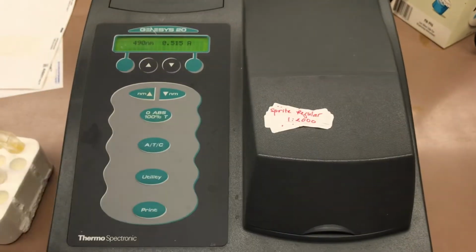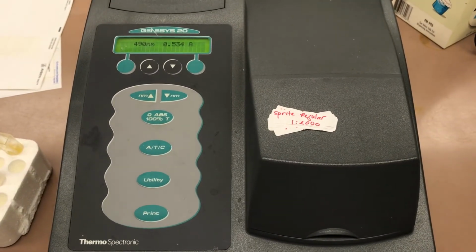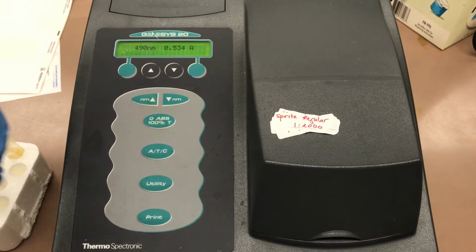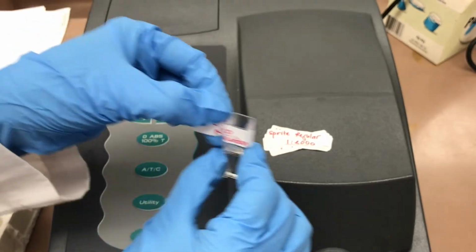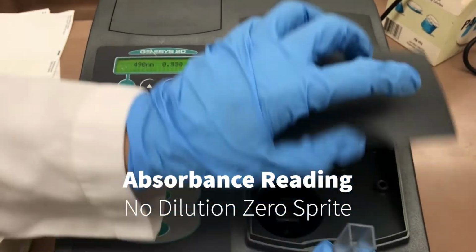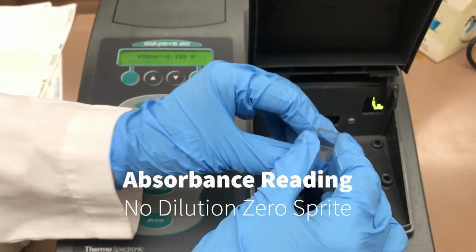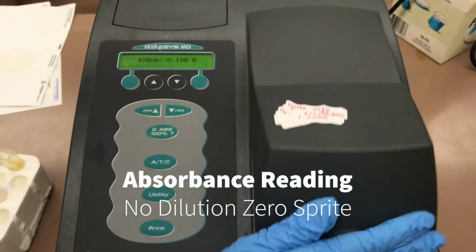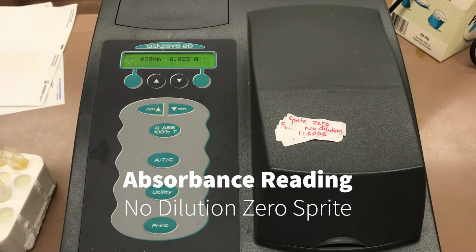This is the absorbance reading for regular Sprite. This is the absorbance reading for zero Sprite.